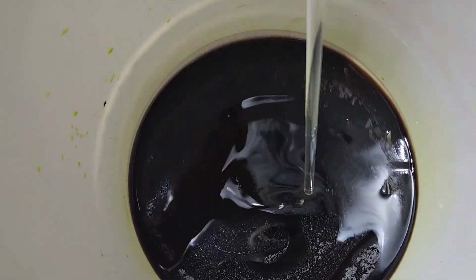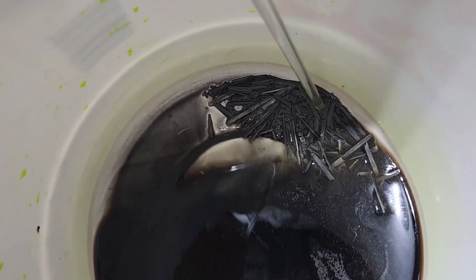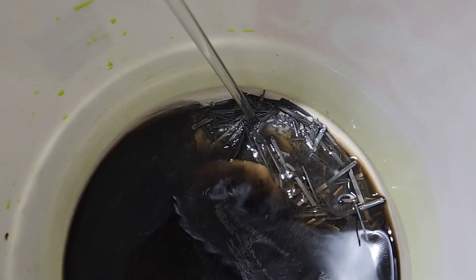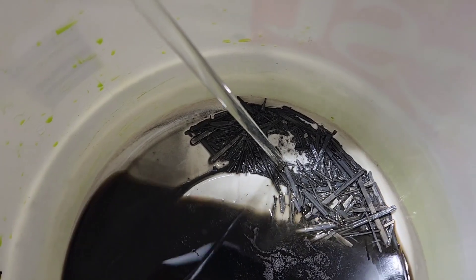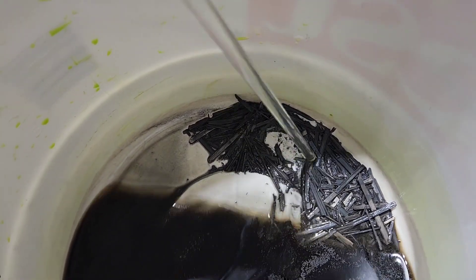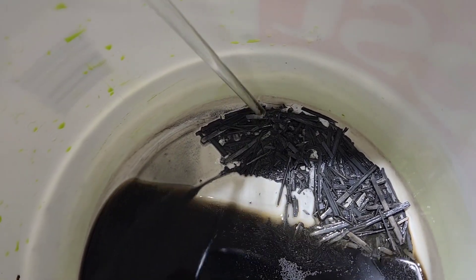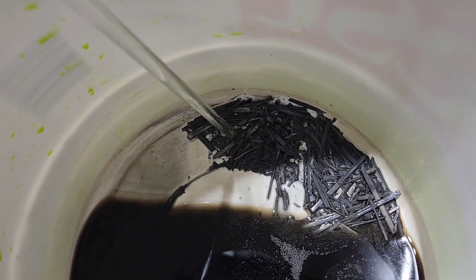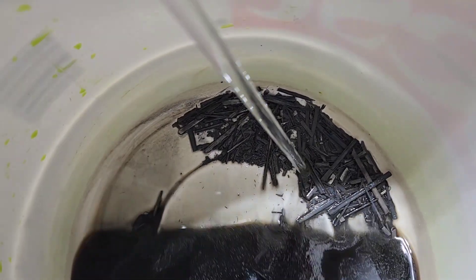This has been sitting for about two weeks. I moved it over to an actual gallon container. Look at that — I've always kind of explained it by saying it feels inquarted. Like when you inquart gold and then run it through nitric, you kind of feel spongy, and that's exactly what this feels like.